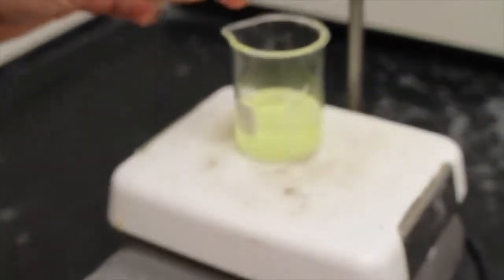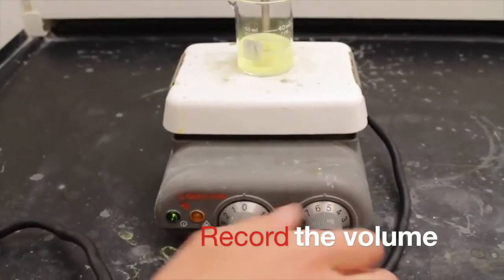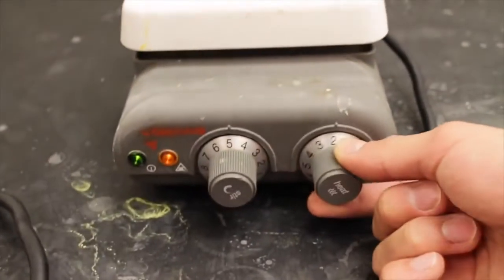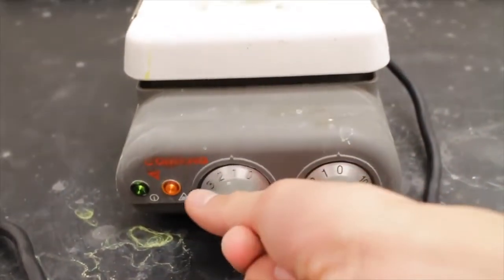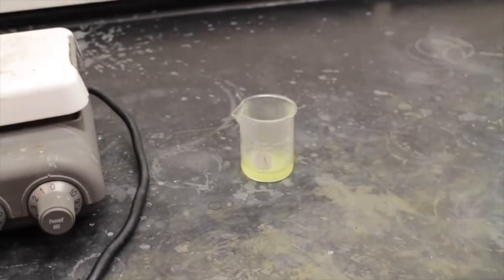Put the stir bar inside the beaker. Make sure you note the volume before you start boiling. Let it boil until you have 7 to 10 milliliters of the mixture left. When it's cold to the touch, remove it from the hot plate and allow any solid to settle.